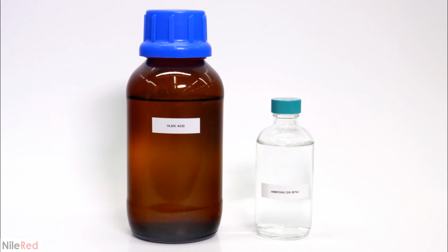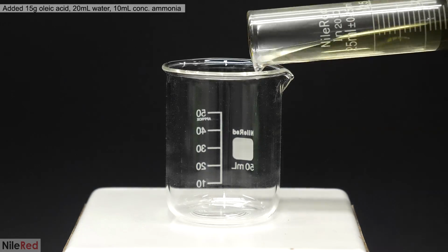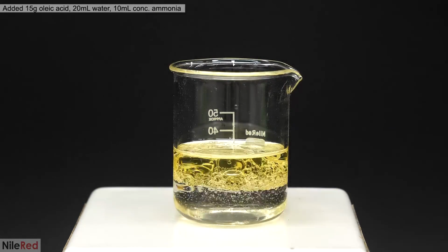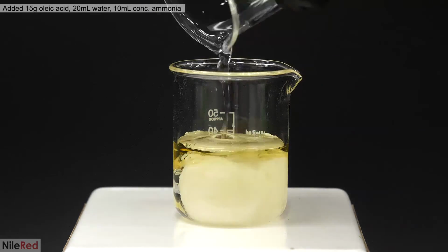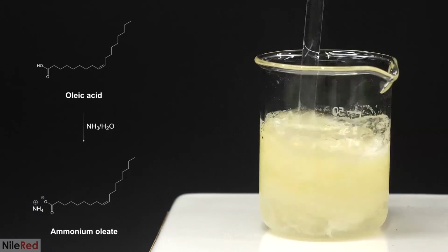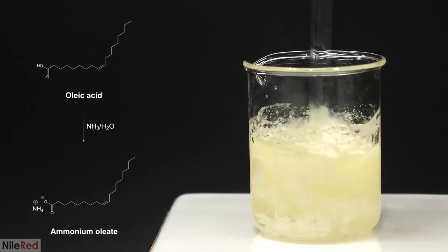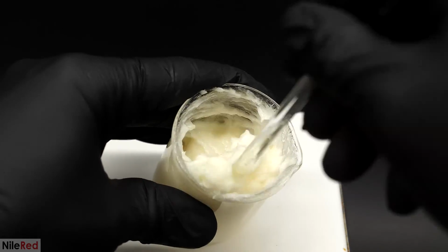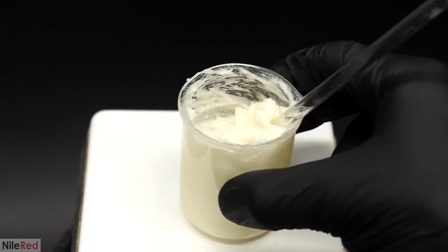This was done using oleic acid, which I got from eBay, as well as some more of the concentrated ammonia solution. So into a beaker, I added about 15 grams of oleic acid, followed by 20 ml of water and 10 ml of the ammonia. Almost immediately, the ammonia reacted with the oleic acid to form a soap called ammonium oleate. I stirred this around until it became a nice and thick goo, and it was basically ready.